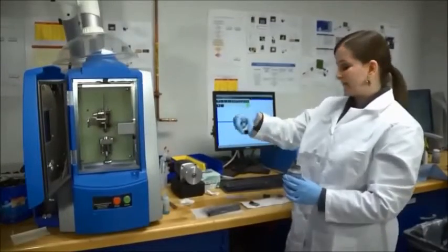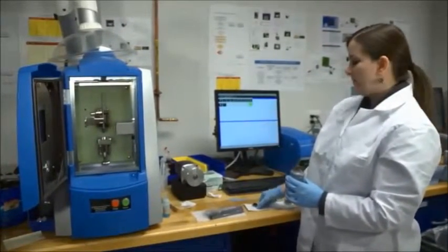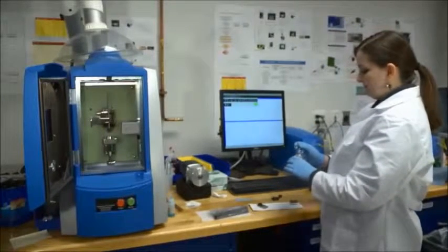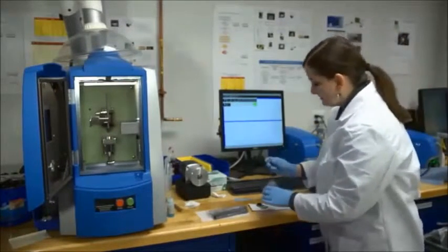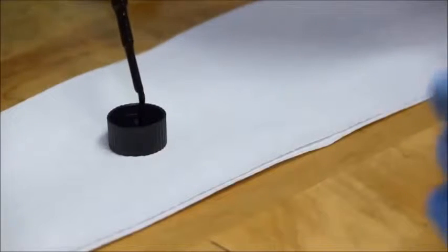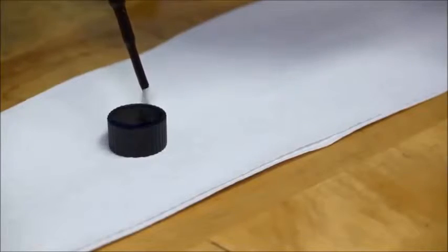And then a sample cap. I'm going to put it in the sample cup holder, and you want to fill the cap until it's completely level.